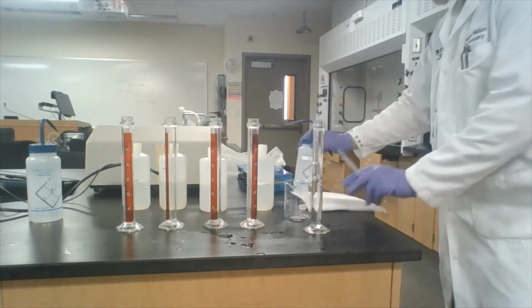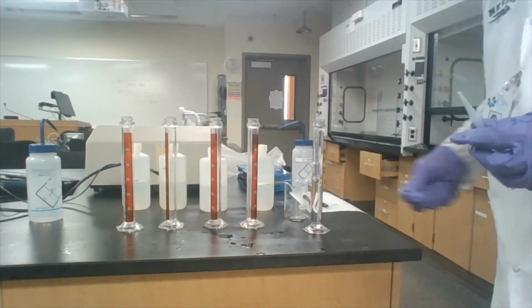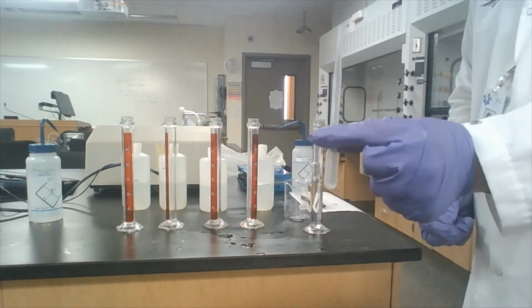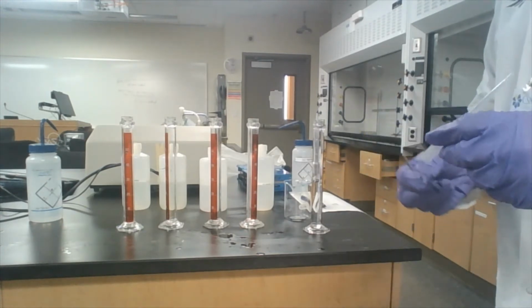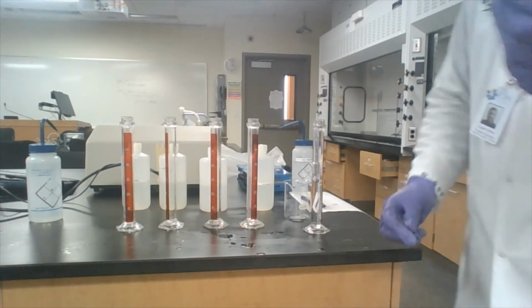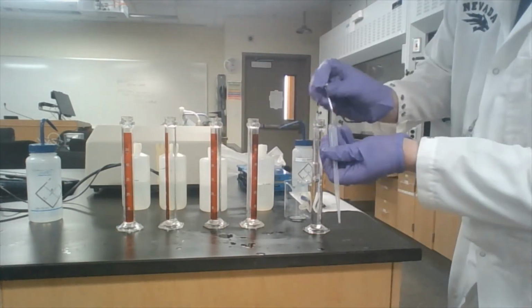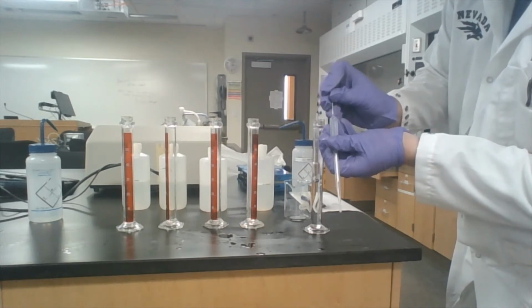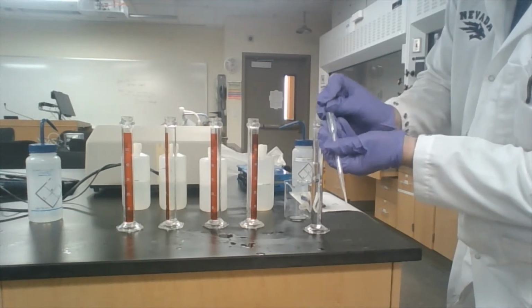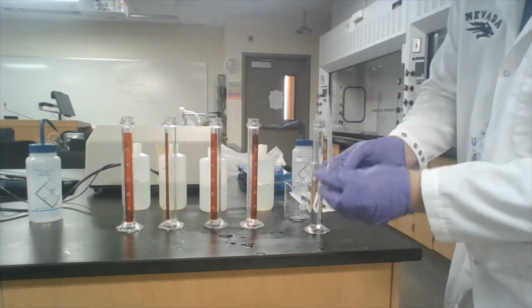So first what you would have to do is build a hydrometer. I already have one in there because the water one is sort of picky. This is a rudimentary way to build this, but it will work for purposes of today's lab. You take this pipette, you take a nail with a washer, and you shove it straight through the bottom, trying not to hit any other plastic once you puncture, or pull it back out. Okay, this should create a watertight seal.